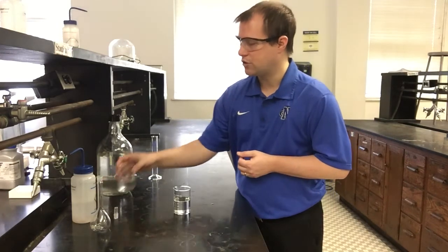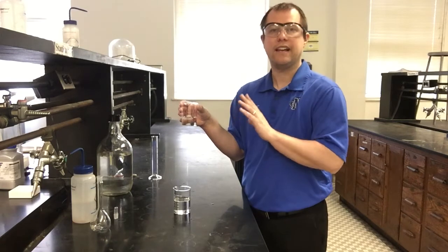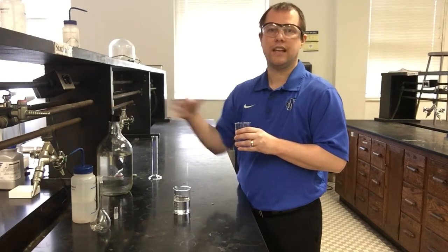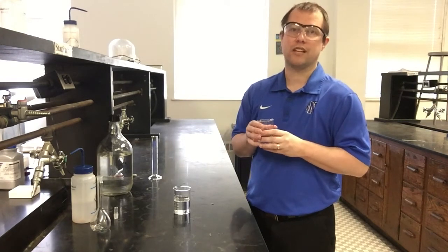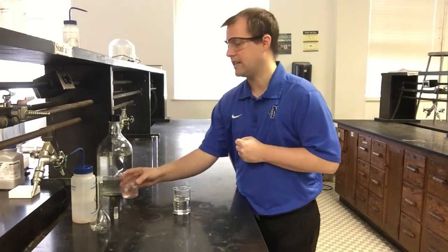So I have our stock solution poured out here in a small beaker. I don't know if you can quite read the red marker labels, but anytime you pour the contents of a larger stock solution of this sort into a small beaker, always label that beaker so that you know exactly what is in there. Some people might think it's water, and if they use it for something and it's not water, they're going to be in for an unpleasant surprise from either a reaction standpoint or maybe even a safety standpoint. So always good habits: label everything when you're going to take stuff out of a container.